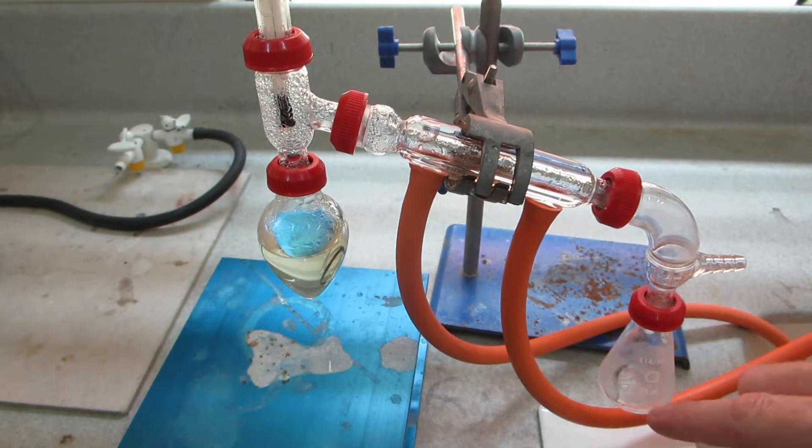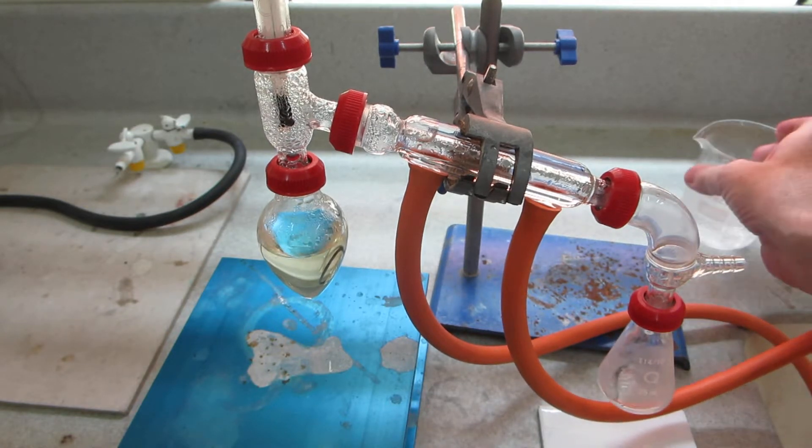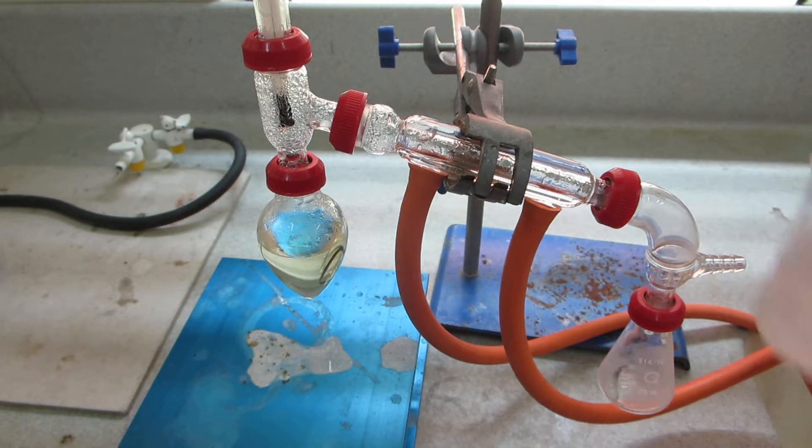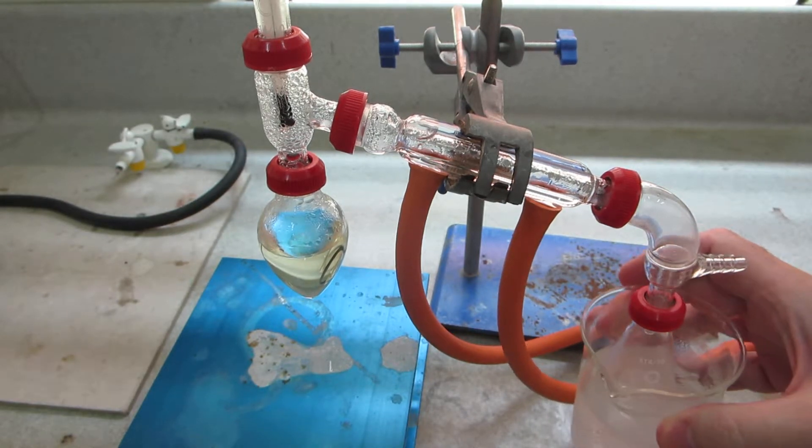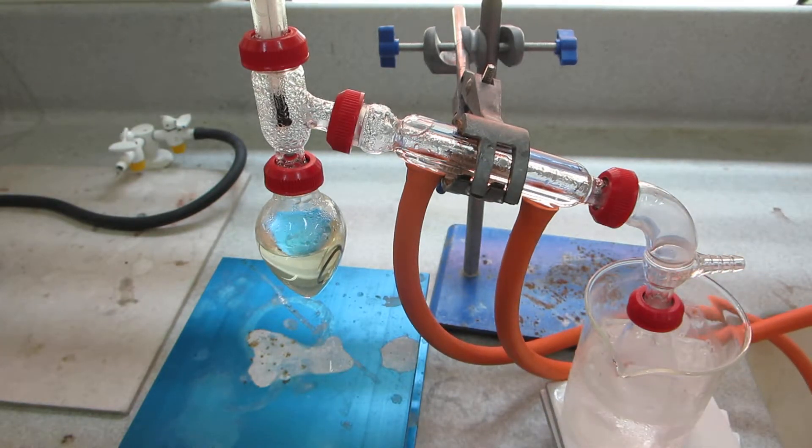Let's leave that in ice because we're expecting a very volatile material. So we'll leave that surrounded by the ice beaker to start off with, and we're going to conduct a Tollens silver mirror test.